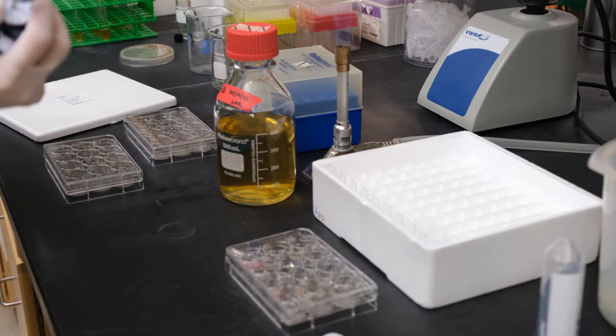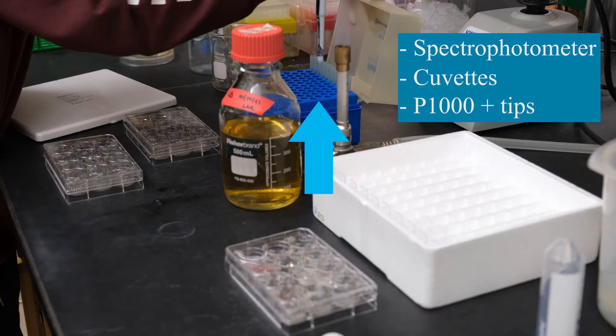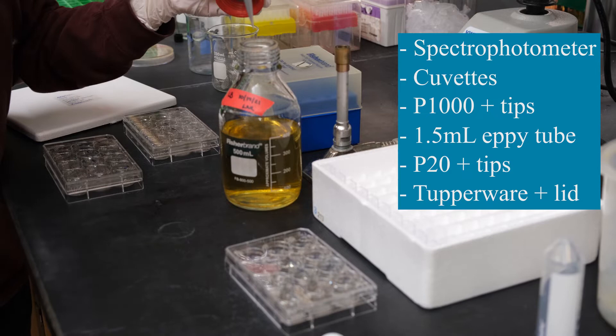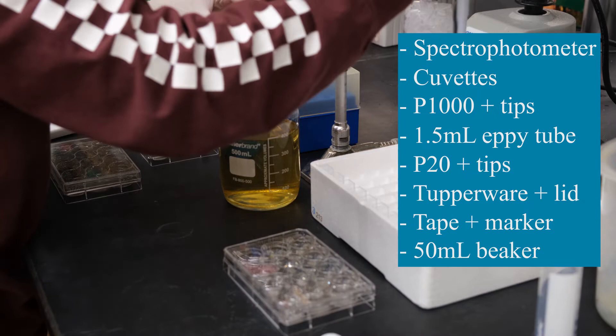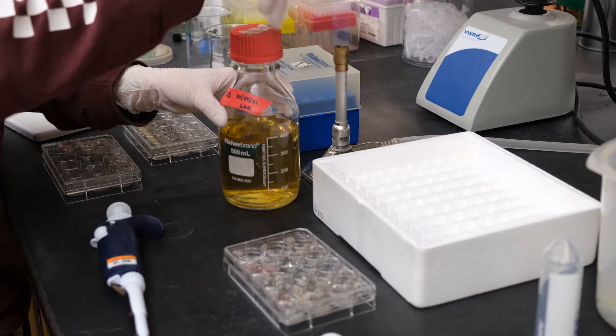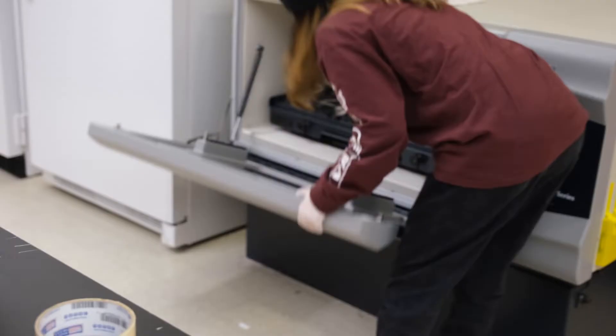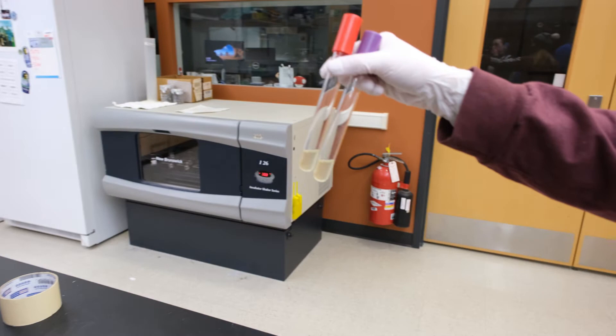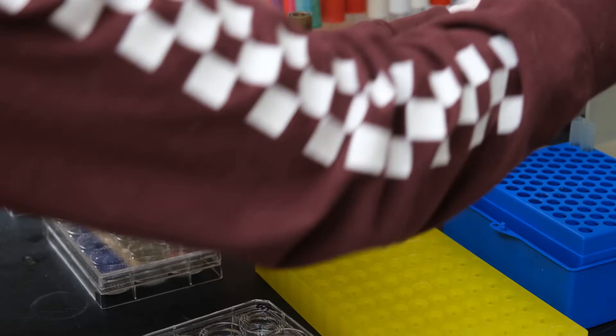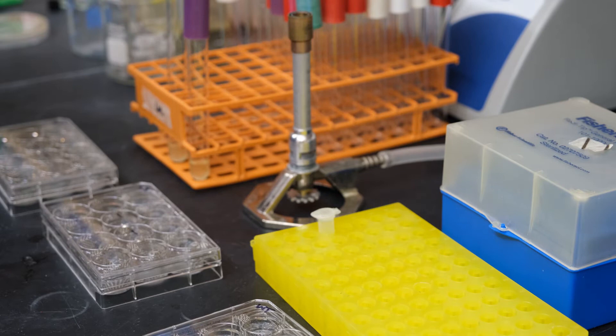Next we'll inoculate our biofilms. So for this you'll need a spectrophotometer, cuvettes, p1000 and tips, 1.5 ml eppendorf tube, a p20 pipette and tips, a tupperware with a snap-on lid, labeling tape and a marker, and a 50 ml beaker which you'll fill with water. After your LB cultures have grown, check the ODs using a spectrophotometer. ODs should be around 0.75 but the most important thing is that your cells are in log phase and haven't entered stationary phase yet. If your cultures look good and they're happily growing, next we'll use them to inoculate your MSGG wells for biofilm growth.